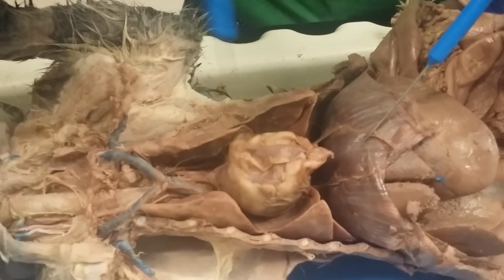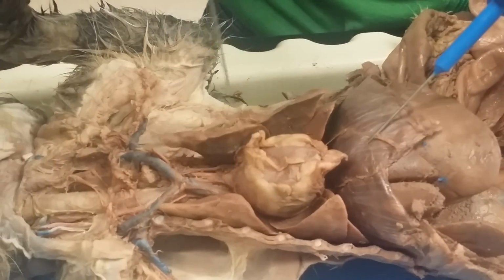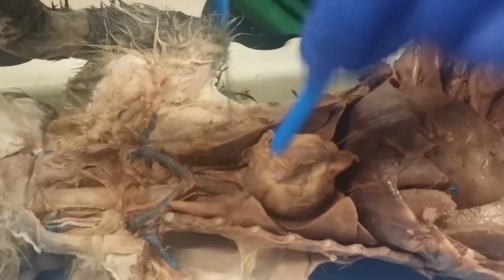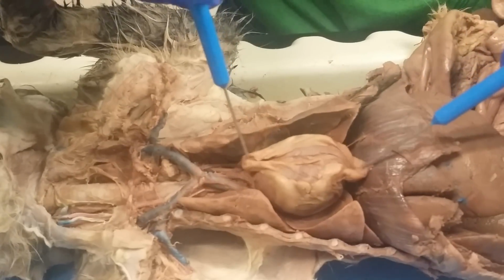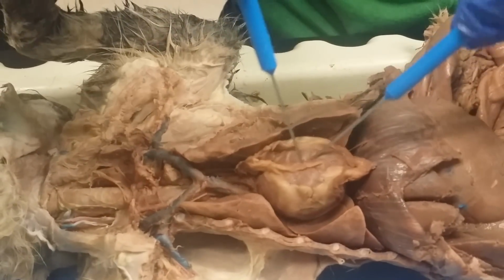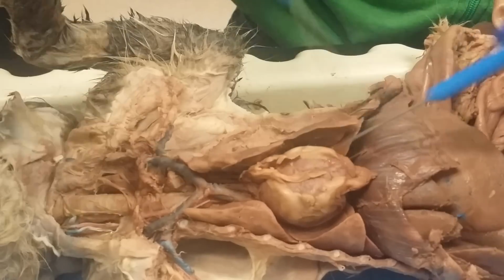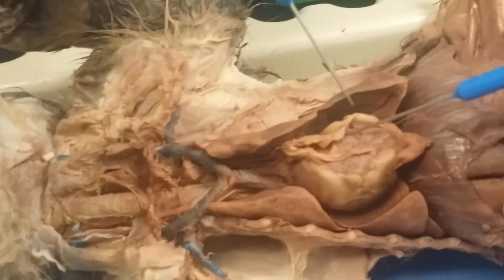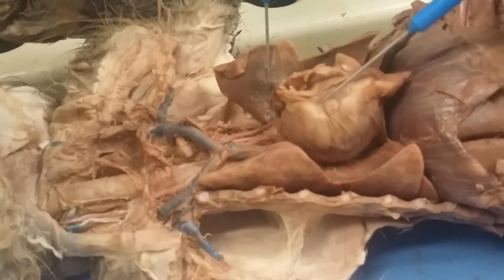Move out of the way, you got the diaphragm, it's right on top of the liver. Then you got the lungs. It talks about the pleura and stuff on that, but you can't tell the difference between the visceral and parietal pleura. Just these are the lungs. This is the heart. If you see a heart that's opened up, then you just know that it's got the 2 atria, 2 ventricles. That's about it that you can really see on the cats. Maybe the pericardial sac might be pinned right here, maybe.